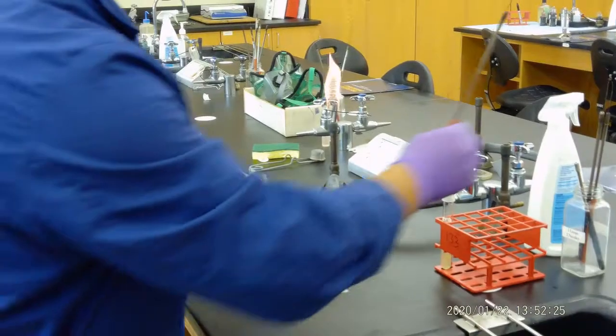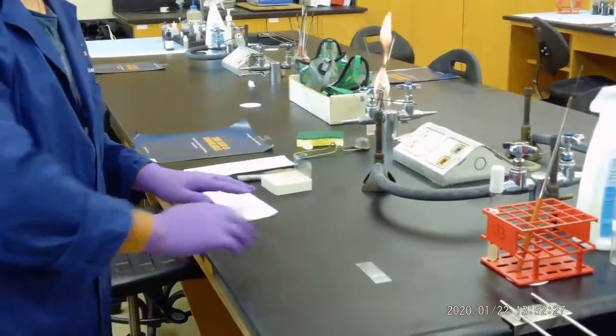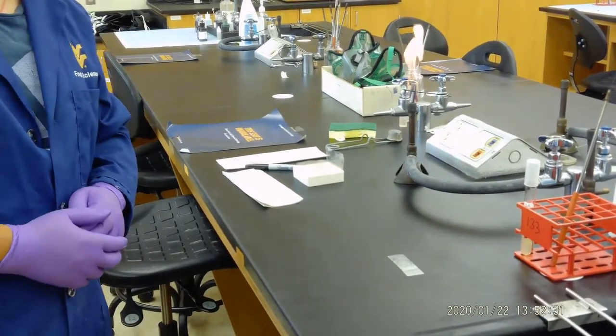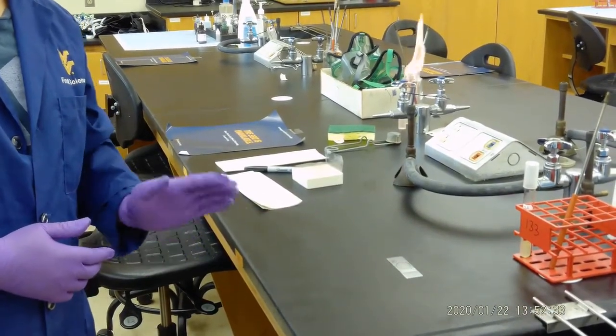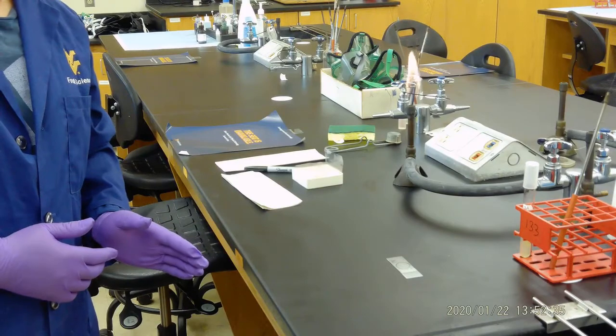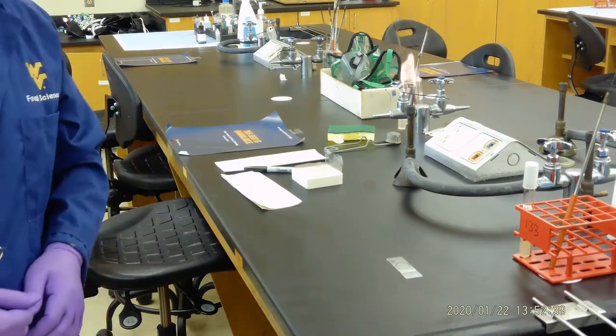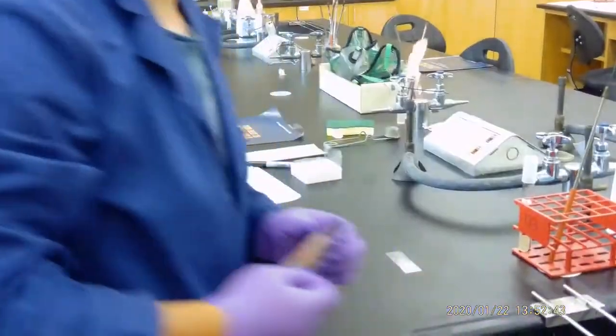Now this step we call it air dry. That needs to be completely done, about three to five minutes we do the air dry. Because otherwise, the microscope will show a lag if we do the observation later on.